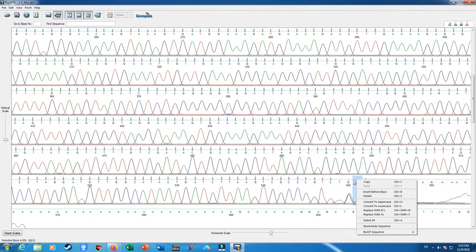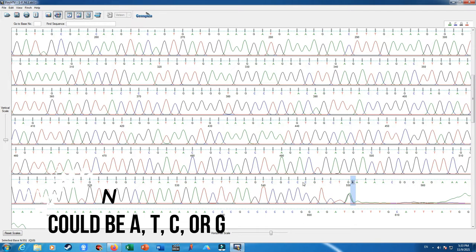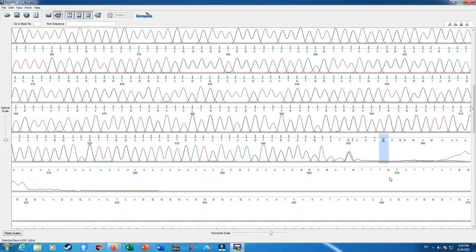I am going to insert a base pair. If you want to insert a nucleotide after one nucleotide, like here guanine, I choose the next nucleotide, right click, and choose insert, or Control B. N stands for any of the nucleotides: adenine, thymine, guanine, and cytosine. So I clicked on N and typed T. After I put the thymine nucleotide after the guanine, I think I'm done here. So I select and delete the other nucleotides at the 3 prime end of our sequencing results.